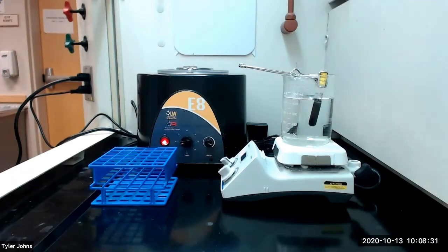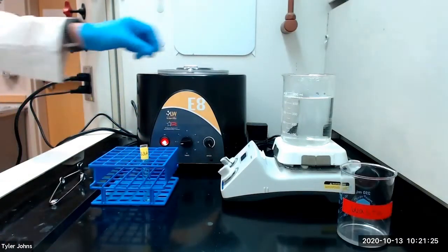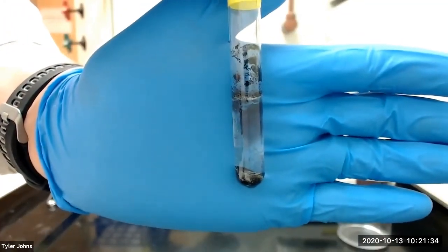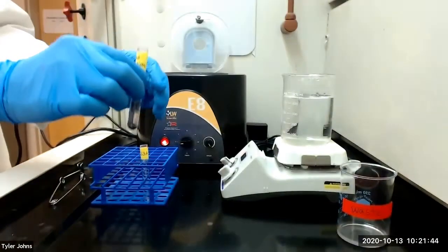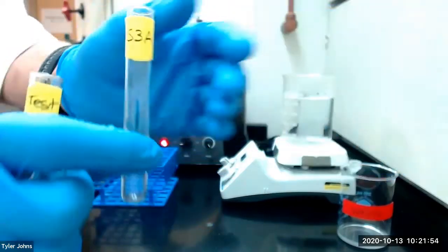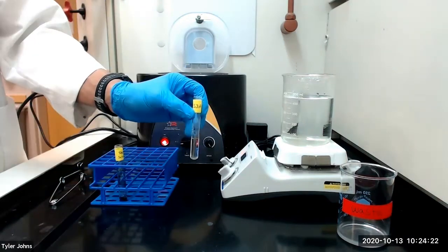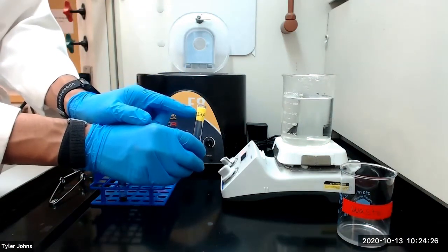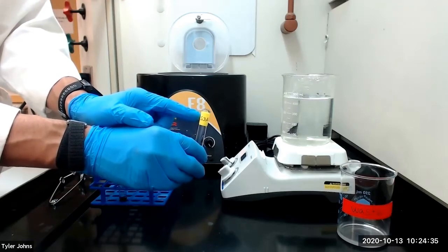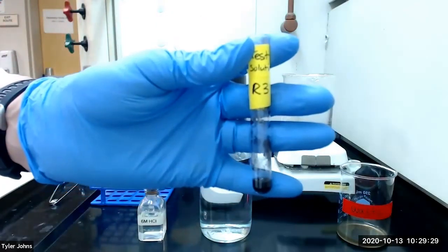After 10 minutes we will centrifuge the mixture. This is what our mixture looks like after centrifugation. We then need to carefully decant our solution into another test tube labeled S3A. Solution S3A will need to be saved if we need to identify ions from the ammonium sulfide group or the carbonate group. For today we do not need to identify those ions, so solution S3A can be discarded. We have relabeled our precipitate as R3 for residue 3.